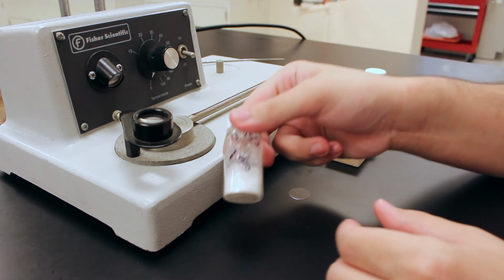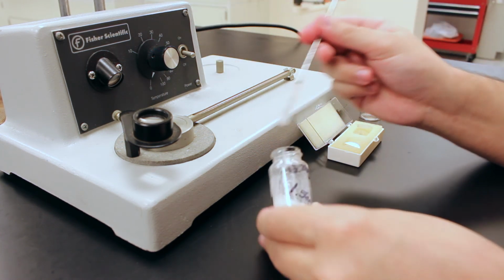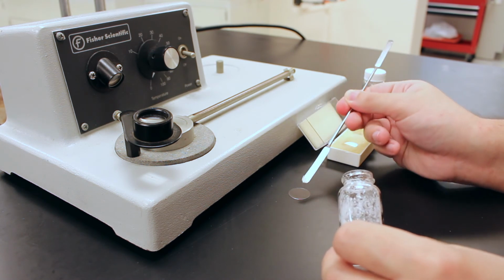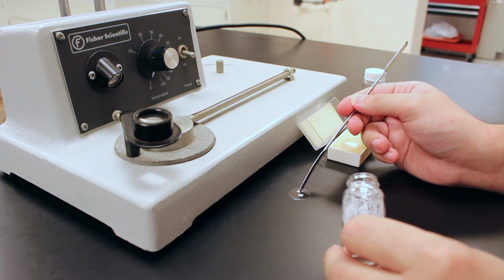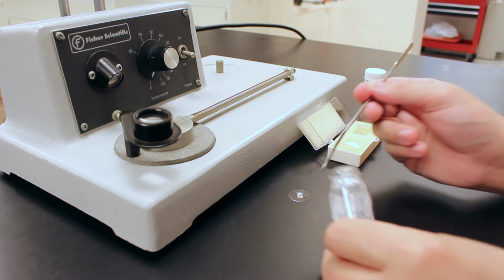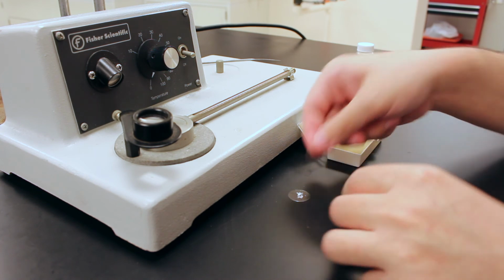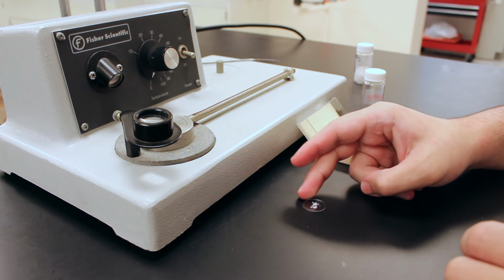So let's start with our purified compound. So I've got my spatula here. I'm just going to take perhaps 1 or 2, you really don't need that much. That looks about right, and we'll place it onto the slide. Okay, I'll try to get them fairly centered. Okay, that looks pretty good. Put the cap back on that, and then we'll take our top slide, kind of sandwich them together. And this is what we're going to use. So this is the first sample.